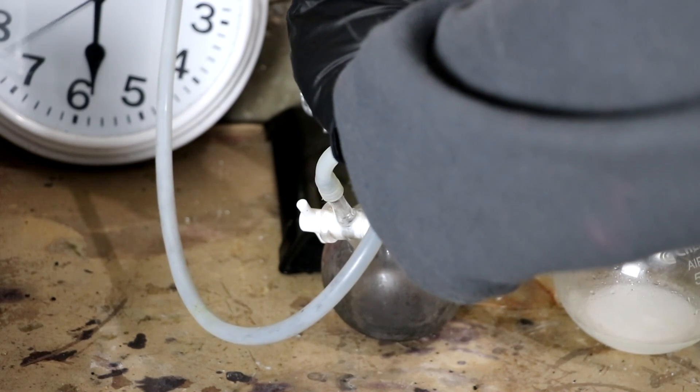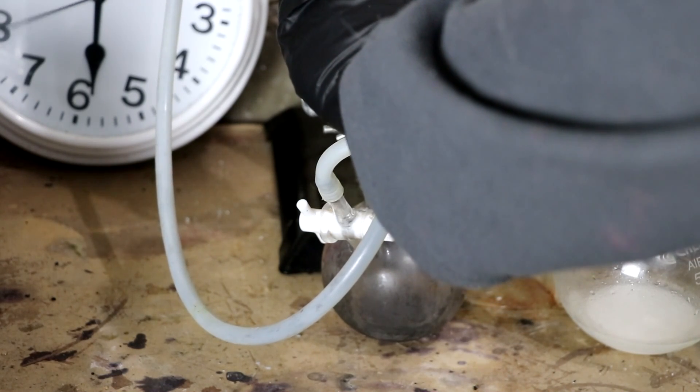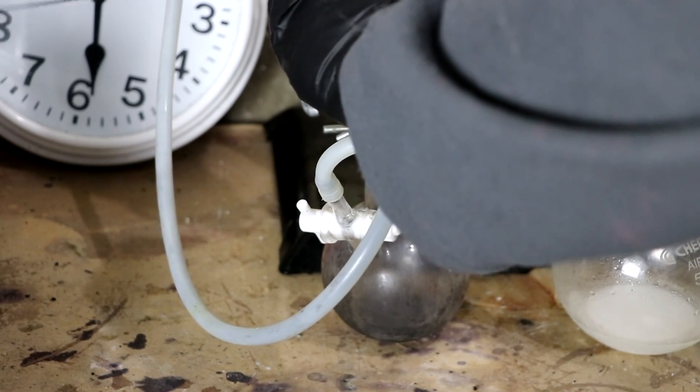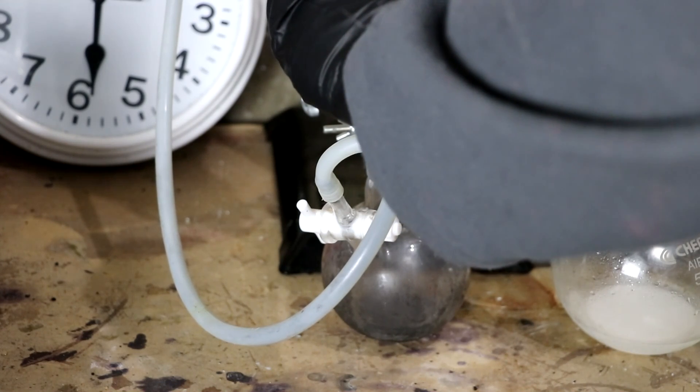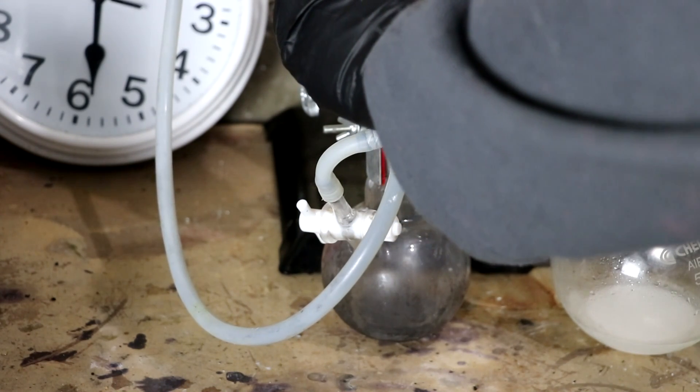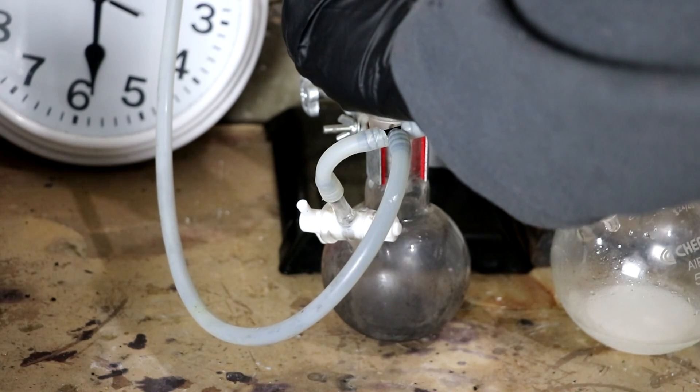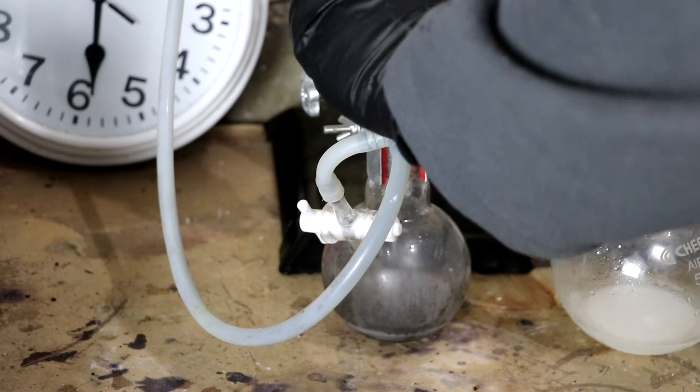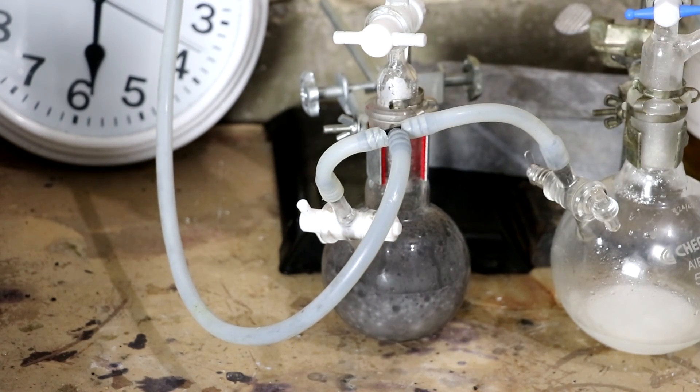I'm going to start with oxygen. So let's put in a little bit of the peroxide onto the catalyst. This will probably be a very vigorous reaction considering that this is happening under reduced pressure. Is that going to boil over? It is, isn't it?